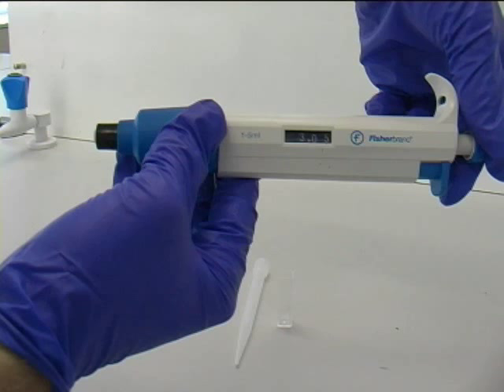For example, if the set point can be changed by 0.2 milliliter increments, then the error associated with volumes dispensed from the pipette will be plus or minus 0.1 milliliters.